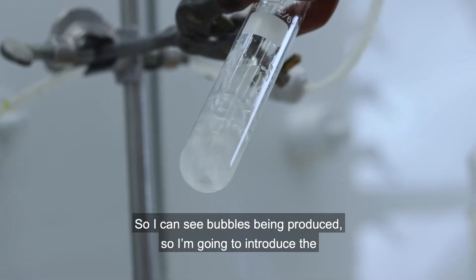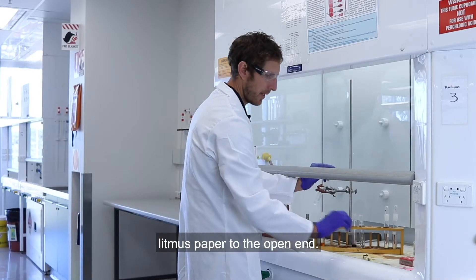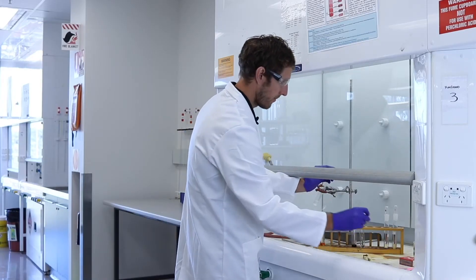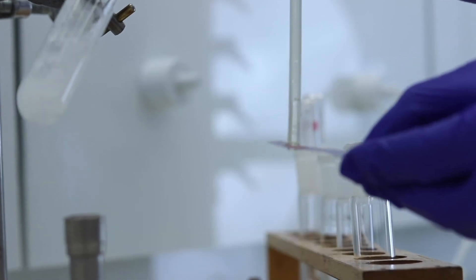I can see bubbles being produced, so I'm going to introduce the litmus paper to the open end — and the litmus paper is turning pink.